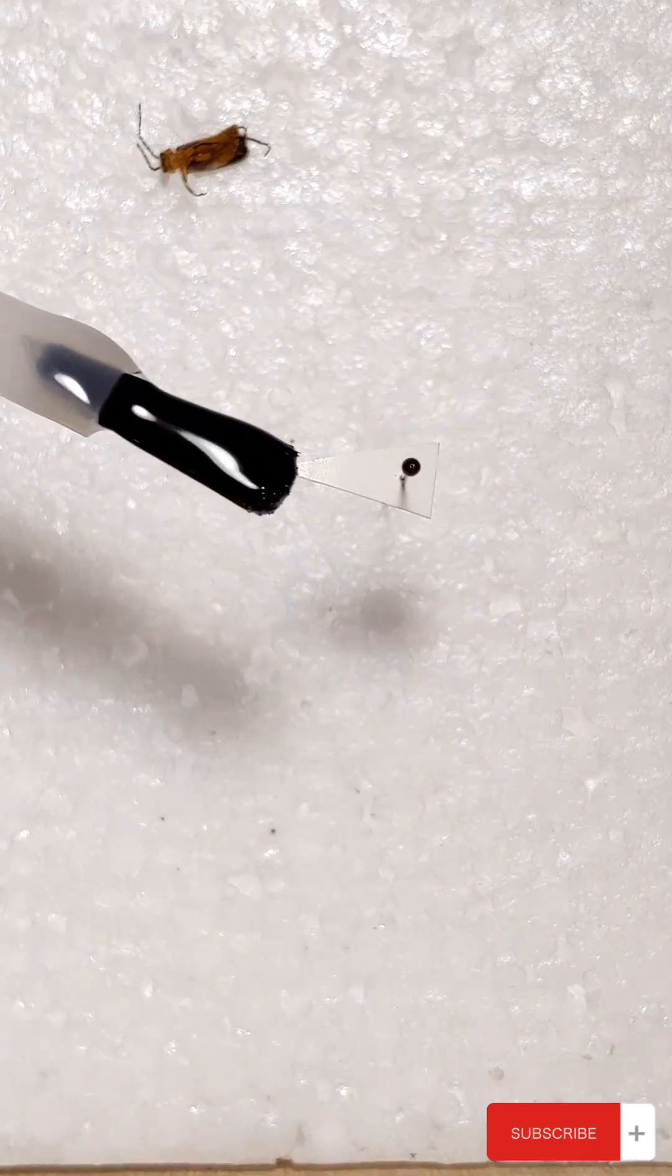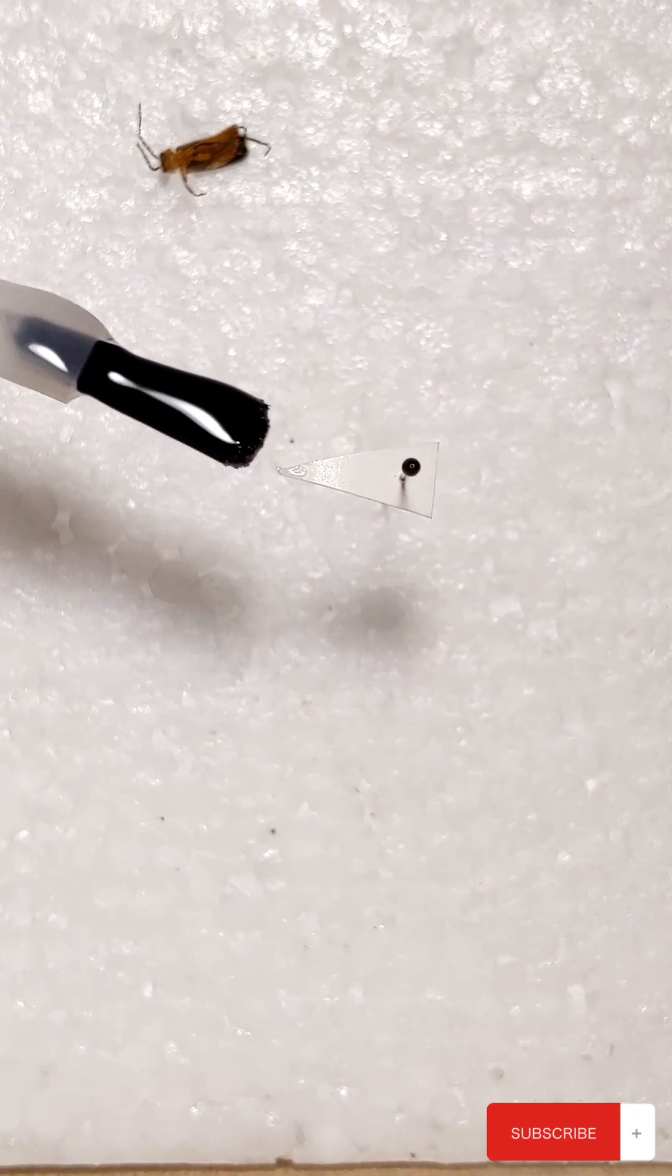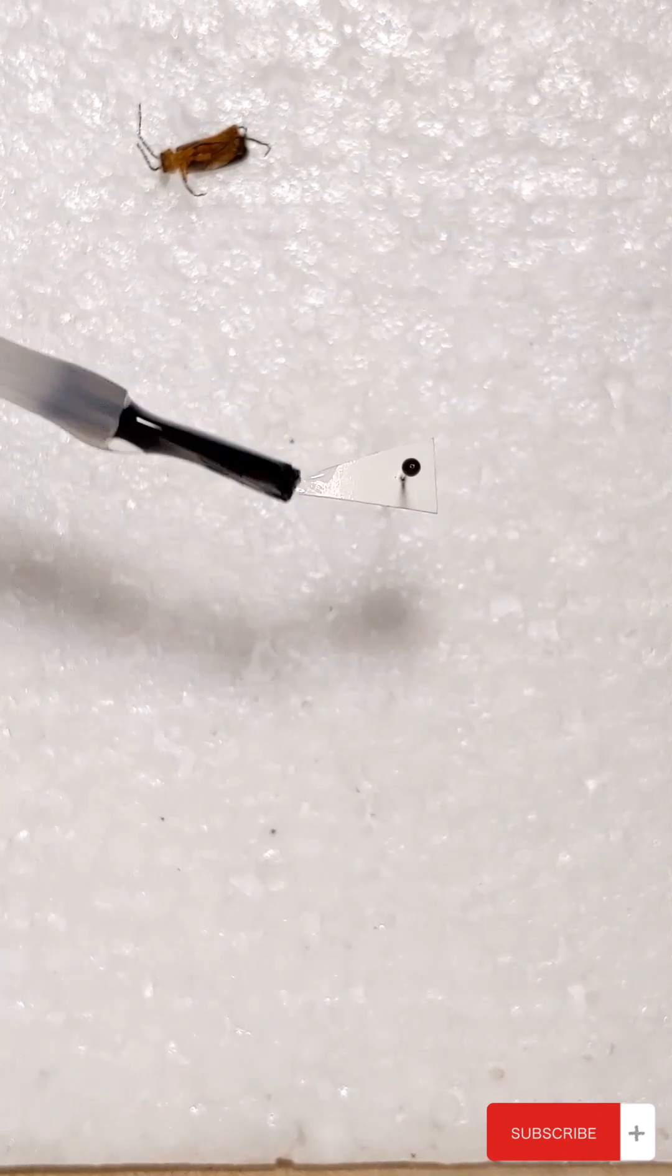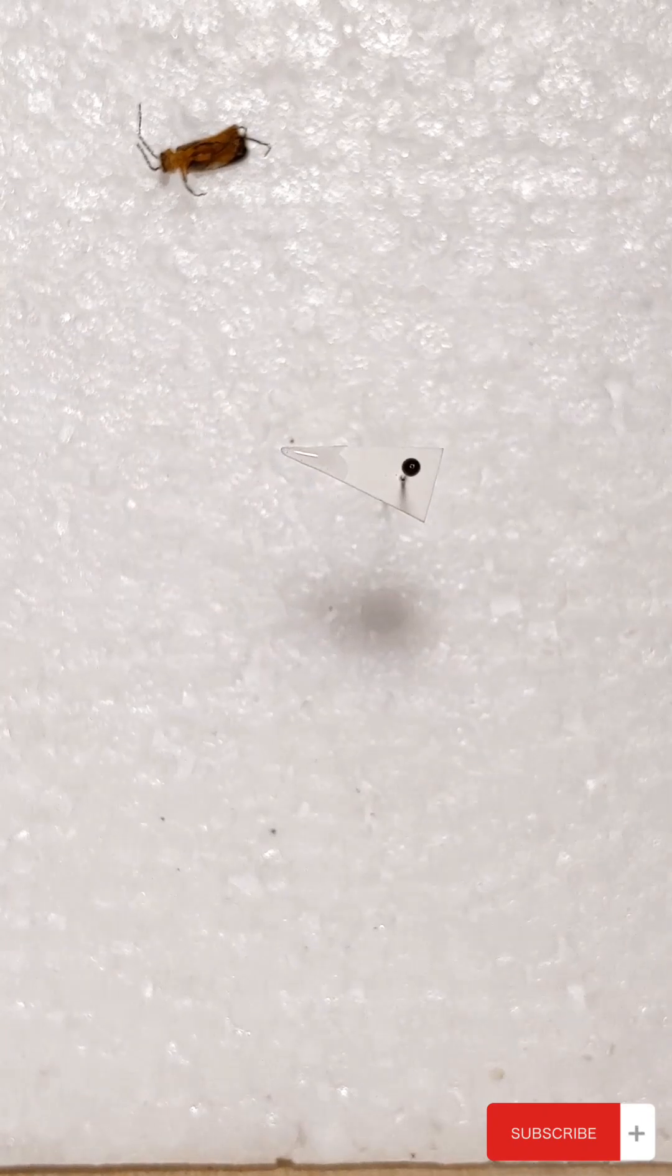Take your nail polish, put some of that on the tip. Try to make a little dot just like that.